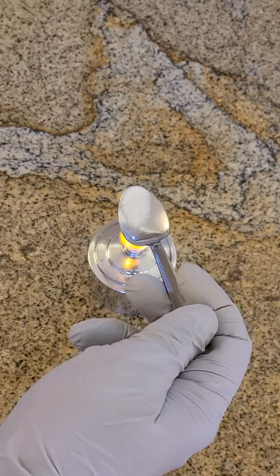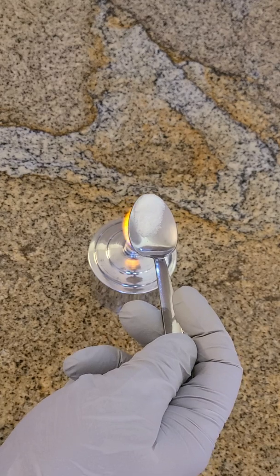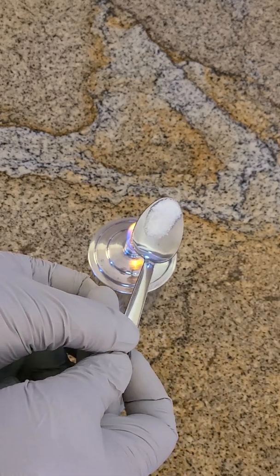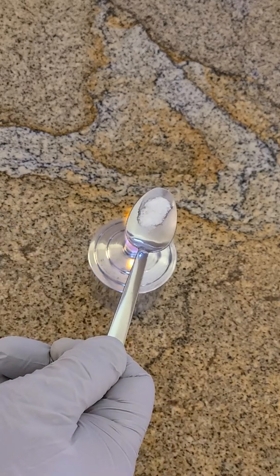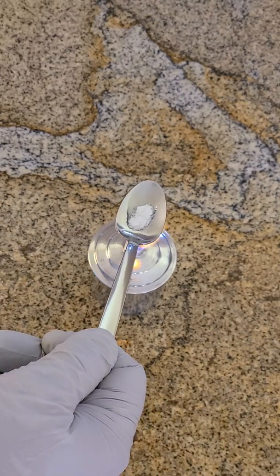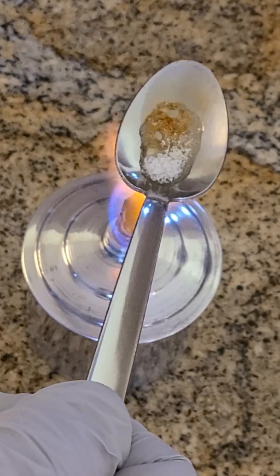So I'm going to just put this over my alcohol burner and see if anything happens. This may take a little bit of time, because the bonds might require a little bit of energy. Now some of you may be used to cooking, and you might know that you can caramelize certain fruits and vegetables when you cook them. You can see it's starting to caramelize.